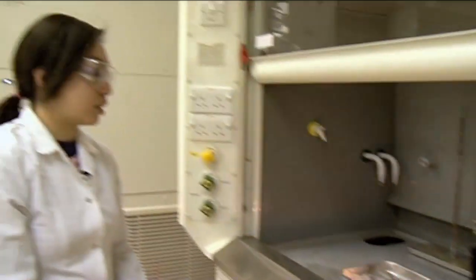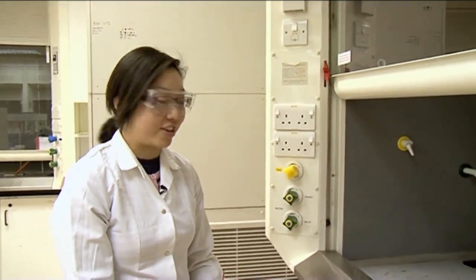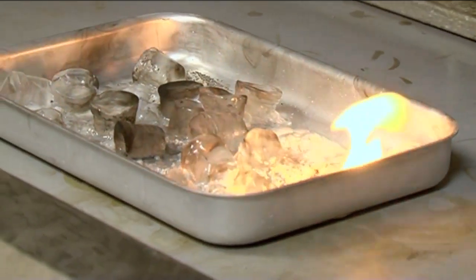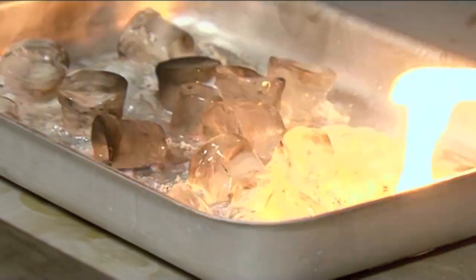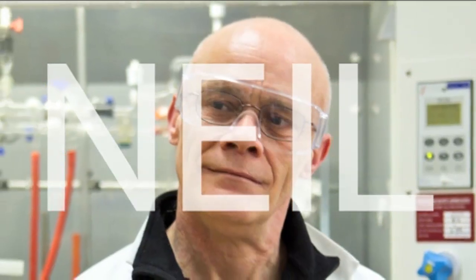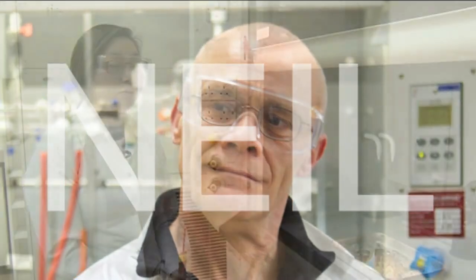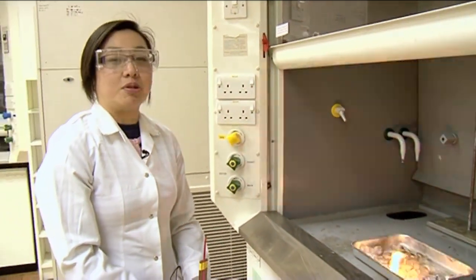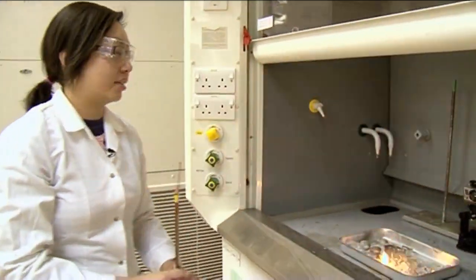So if you find an old adventure story about young children, you may read that they used carbide lamps on their bicycles. It's a really cool, hot reaction — great fun to do. And I think if it was the chemical stig doing this, he'd go bigger than this particular tray. Neil, I believe, is actually off ill. I didn't think Neil could possibly be ill, because Neil is our chemical stig — he is indestructible. More likely he's on covert ops.